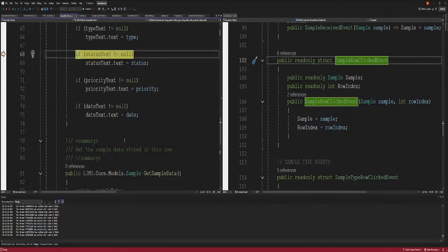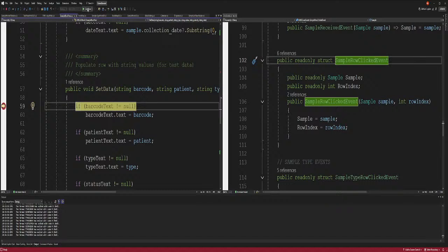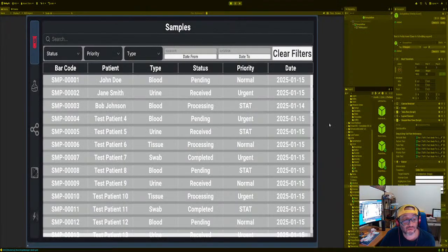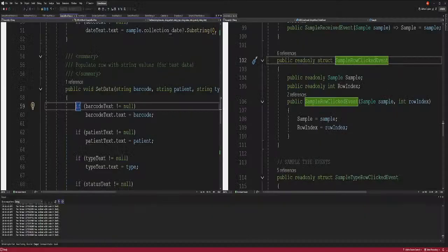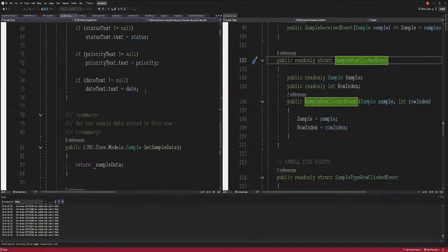So, all right, so now we have to assign the sample. All right, that's cool. We could do that right now. Okay, let it go. So we have two methods, and one of them was working, and the hand scroller was doing the other one, and not the one that we were expecting. So we'll fix that in a minute. So we set the data and then we have to set the sample data, right?